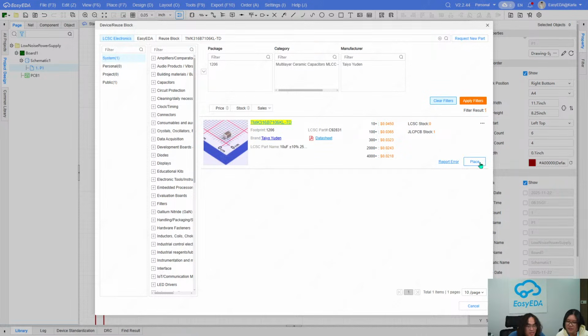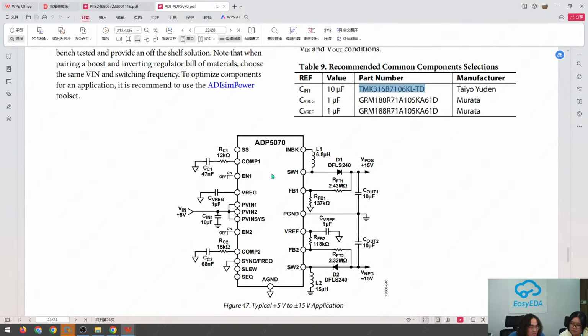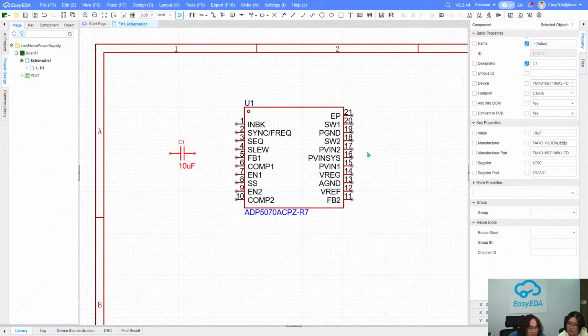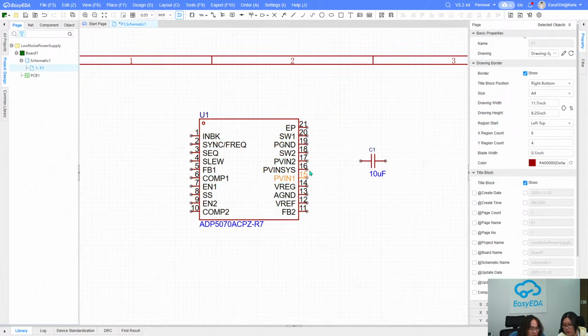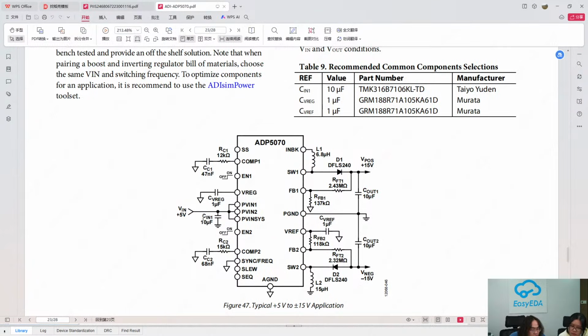So you can place it, like in this case, PVIN1, PVIN2, PVINSYS. Okay, these 3 pins. Where is PVIN1? Here. Okay, PVIN1. We can use shortcut key W to place a wire, and PVIN2, and PVINSYS. Okay, these 3 pins are all connected to this capacitor, and the capacitor is connected to the ground.